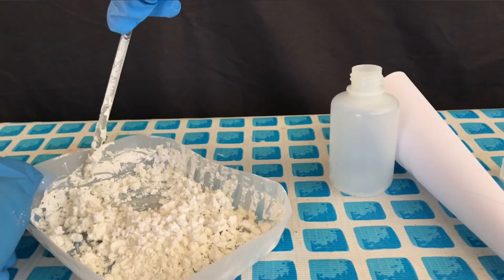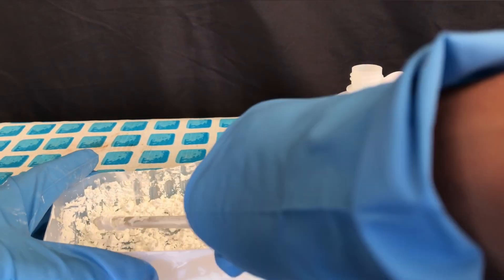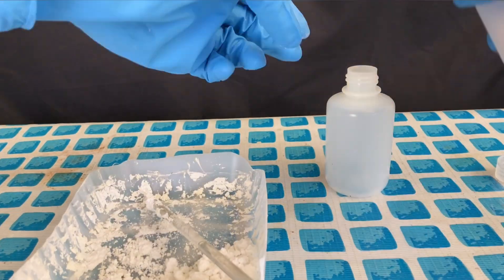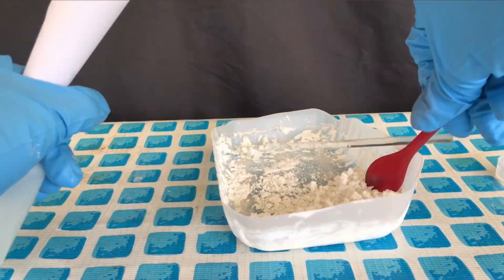After drying it in the sun for two days I still ended up putting it in the vacuum chamber because it didn't want to dry. We dried it over anhydrous calcium chloride.